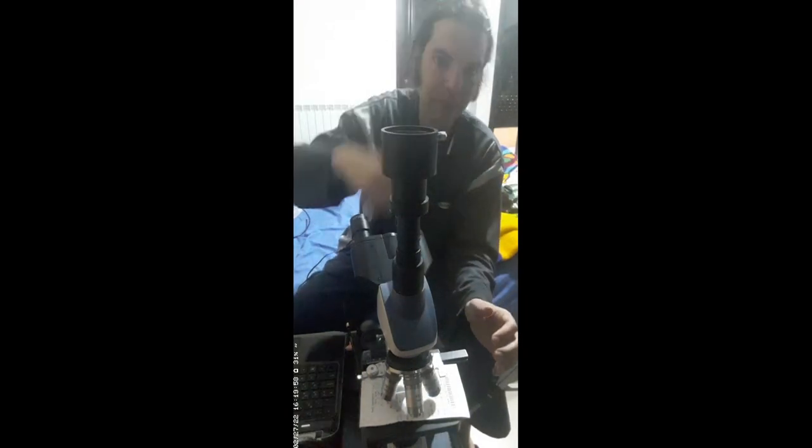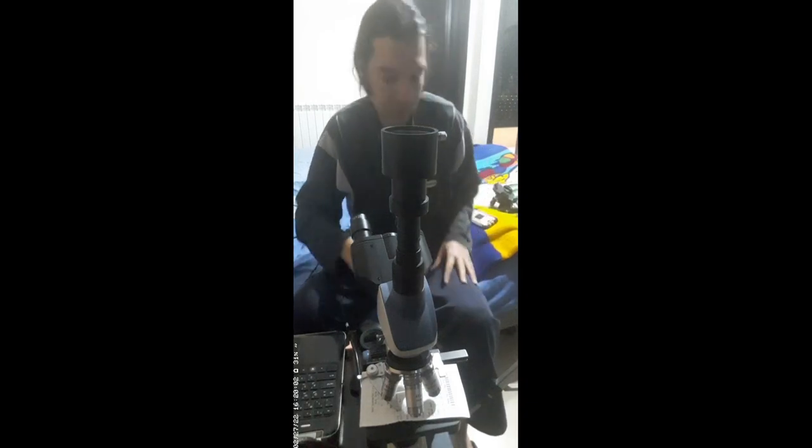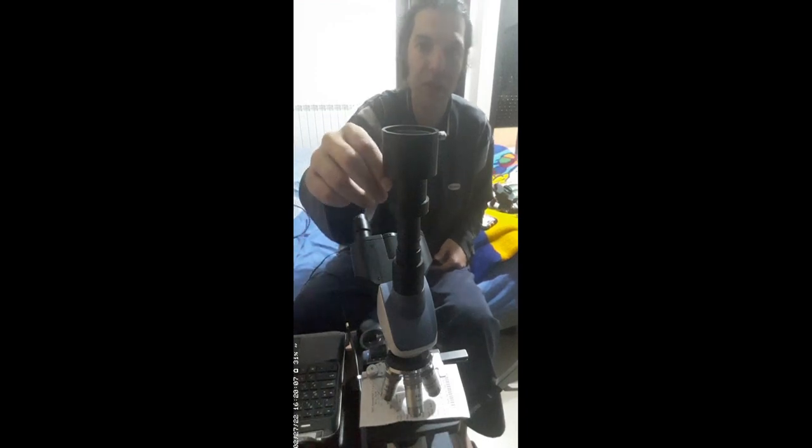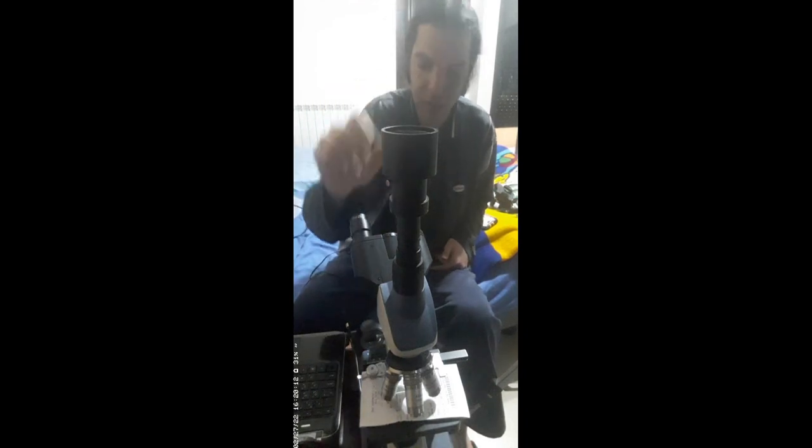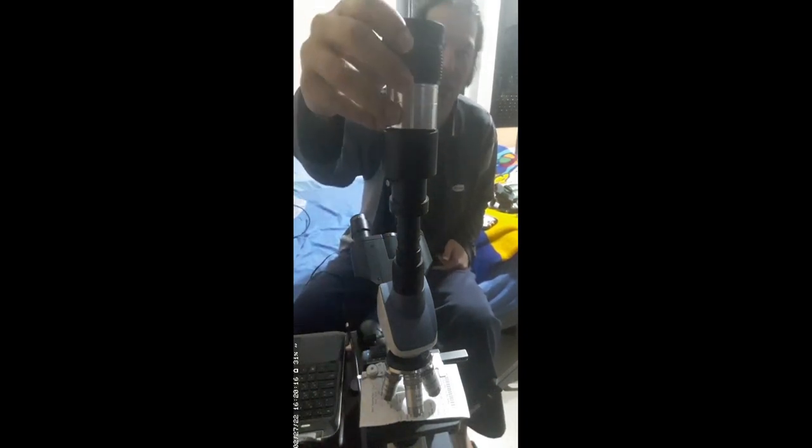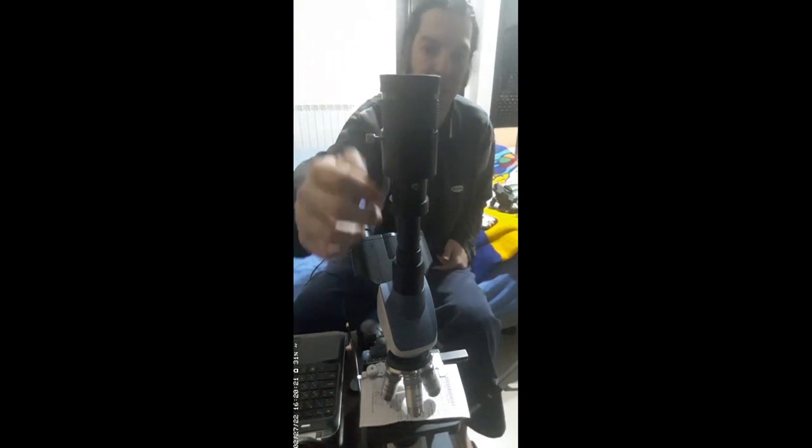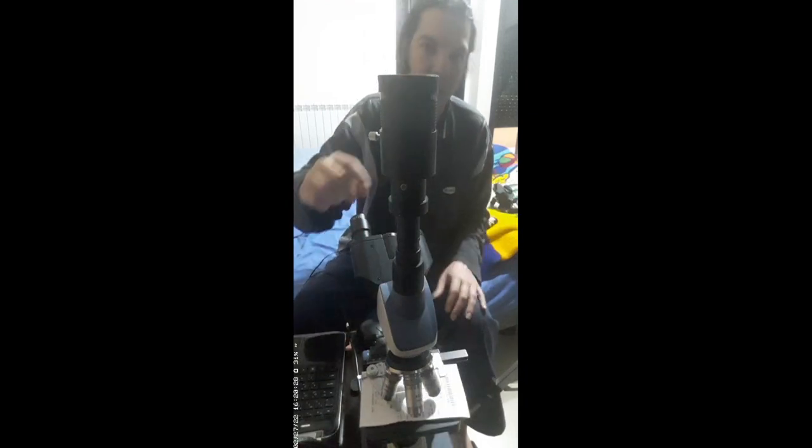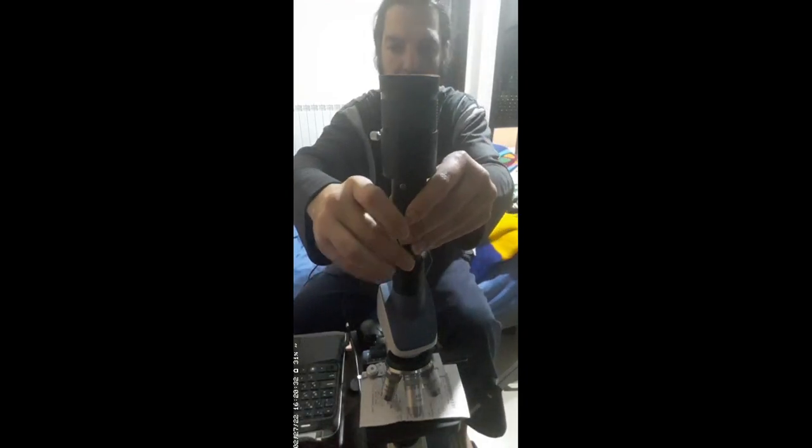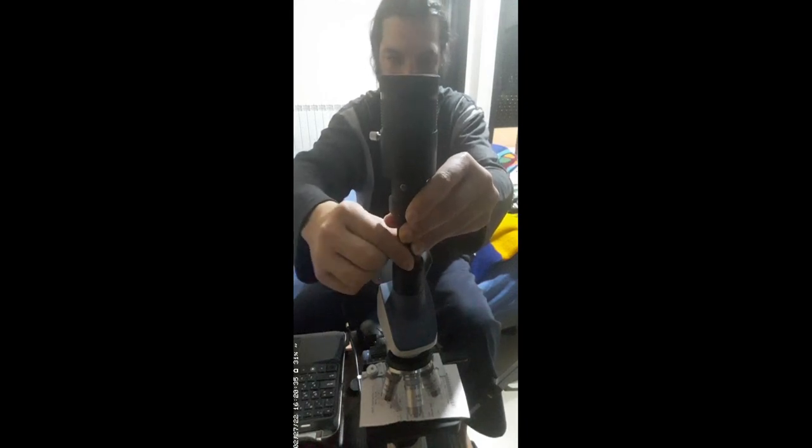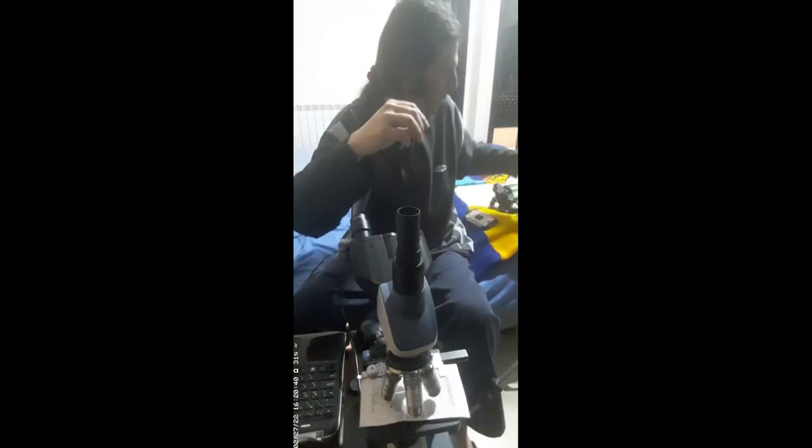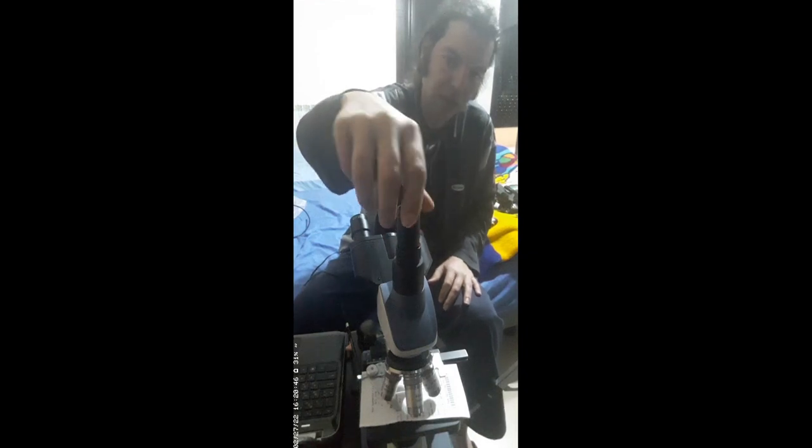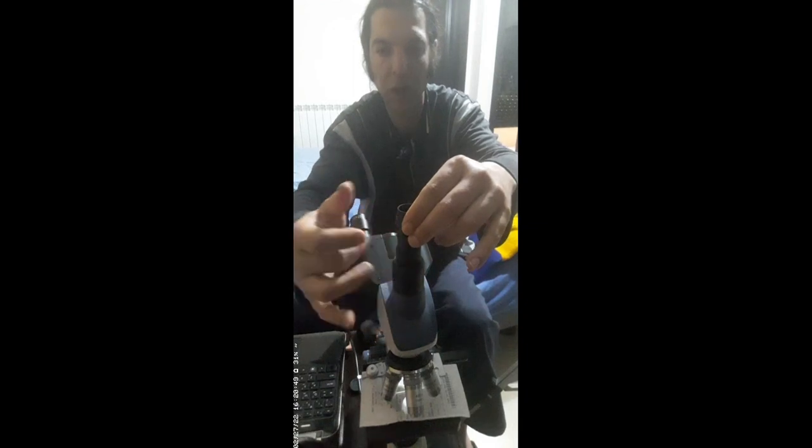Next I get the eyepiece, but before I put the eyepiece, those screws which hold the whole adaptation all together, one part this here is still loose. This is by default from the factory. Also remember there's a screw here.